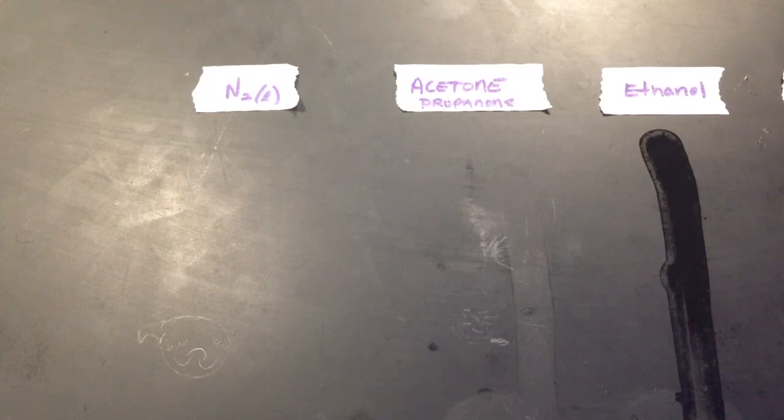Let's take the top winner, acetone, and compare it to liquid nitrogen. Okay? So I need some help here. Reese, come up. Now, I'm not going to dip my finger in liquid nitrogen for obvious reasons. So, Reese, here you take this. Just pour it where it says N2 when I tell you. Ready? We'll do it at the same time. Okay? Let's see who evaporates faster. Okay, ready? On three. 1, 2, 3, go.